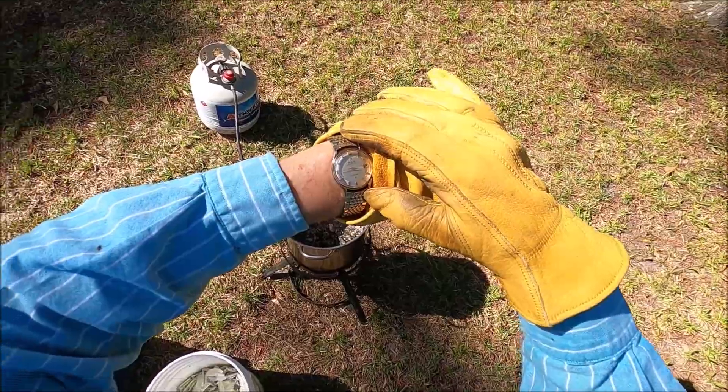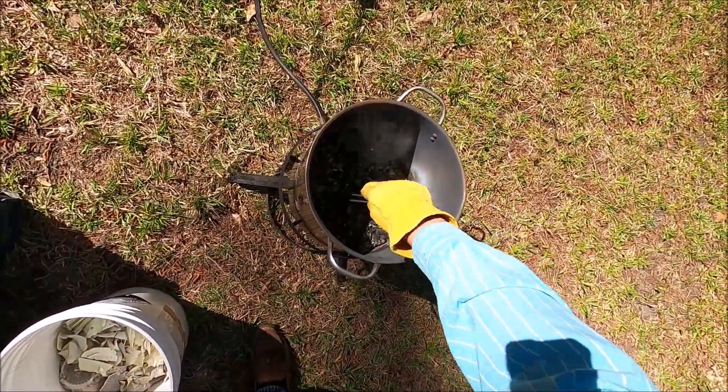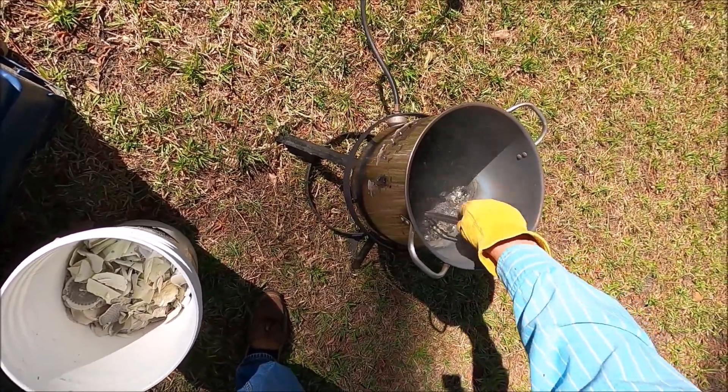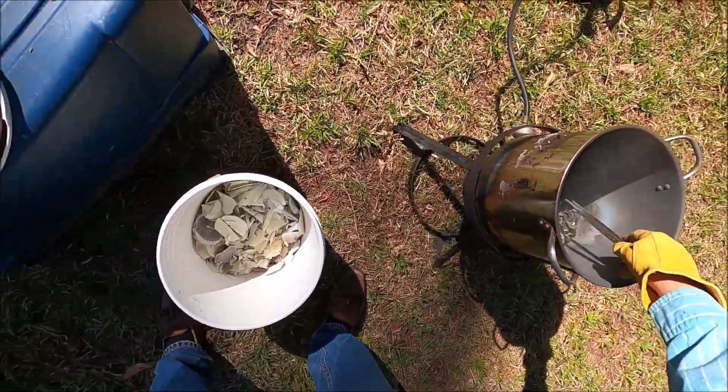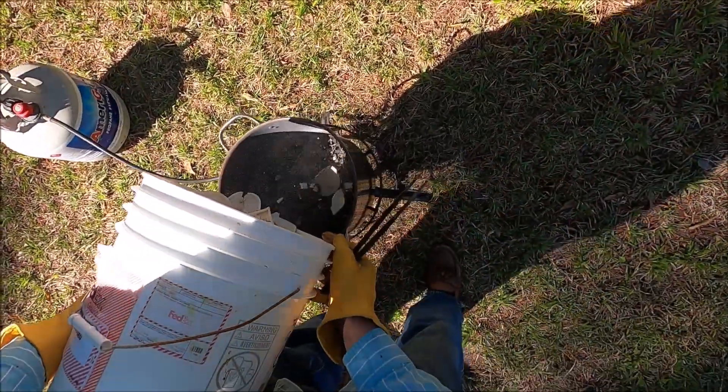Here it's about quarter to four, just a little over an hour and a half to get everything to burn down to this state right here. And now I'll add in the rest of the filter papers from the five gallon bucket.